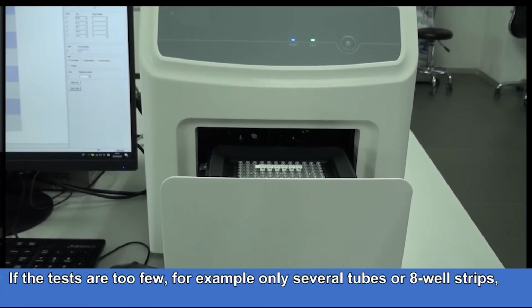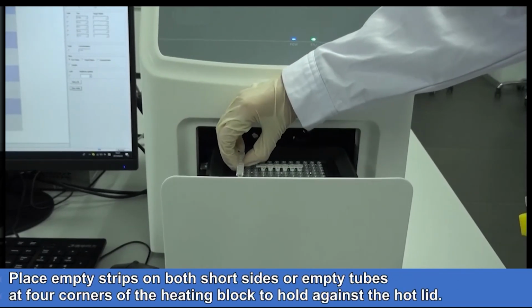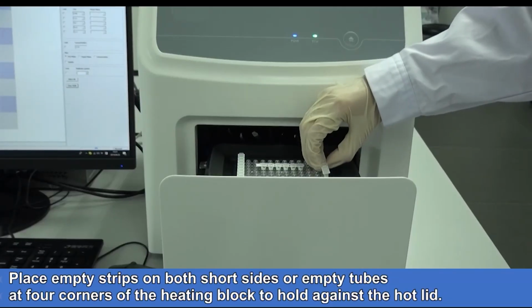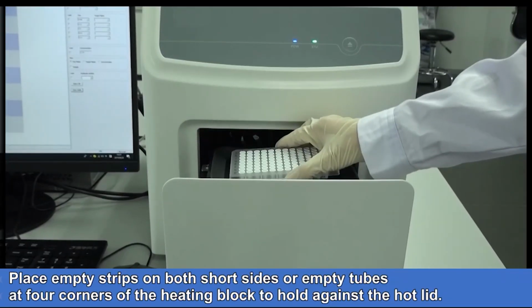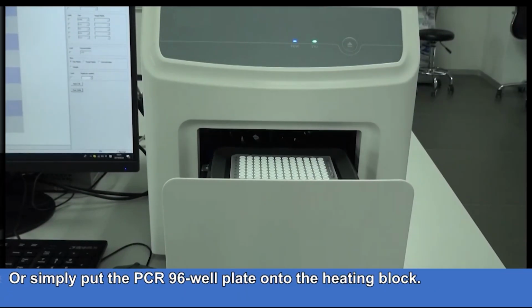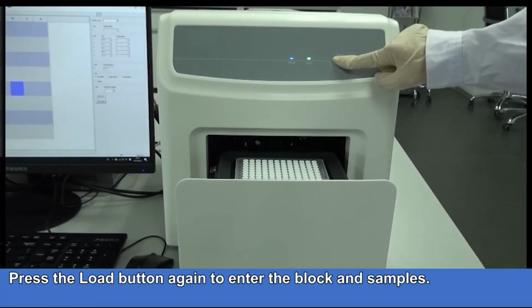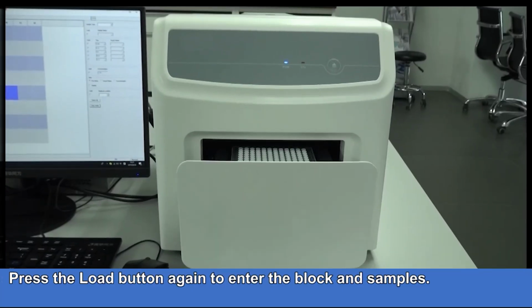If the tests are too few, for example only several tubes or 8-well strips, place empty strips on both short sides or empty tubes at the 4 corners of the heating block to hold against the hot lid. Or simply put the PCR 96-well plate onto the heating block. Press the Load button again to retract the block and samples.